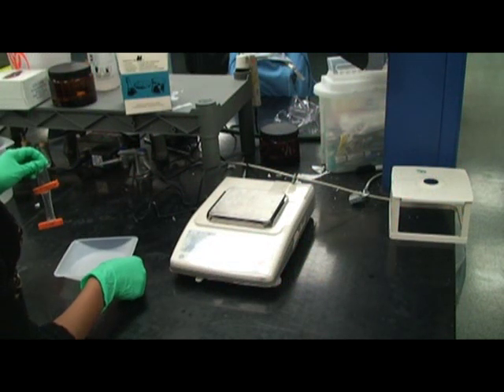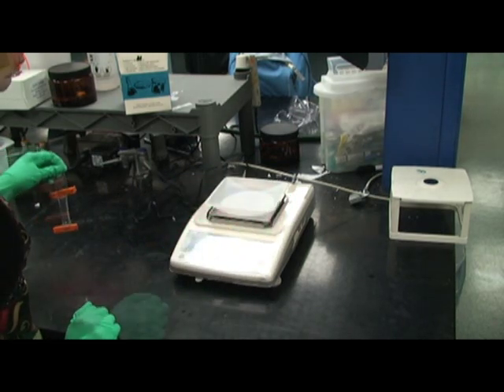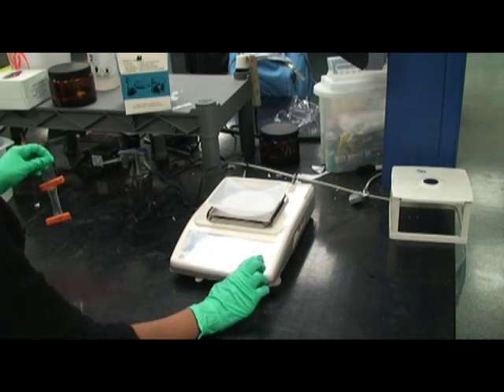Gently wipe each bag dry and weigh it to the nearest point one grams. Record the weights at time zero.